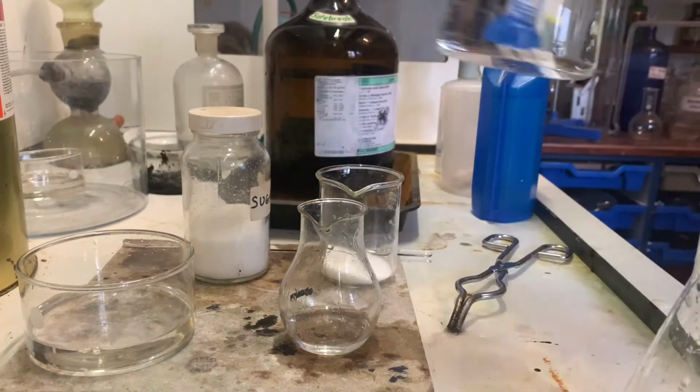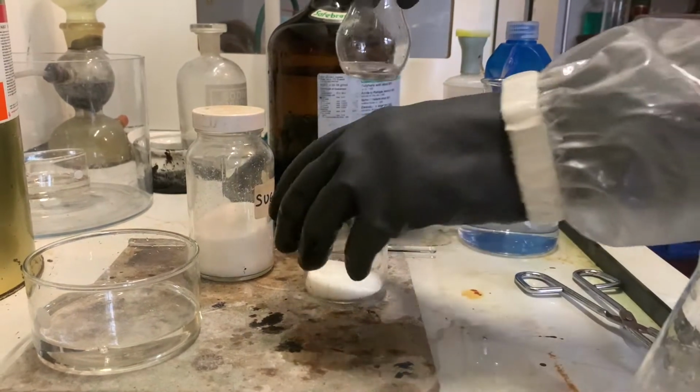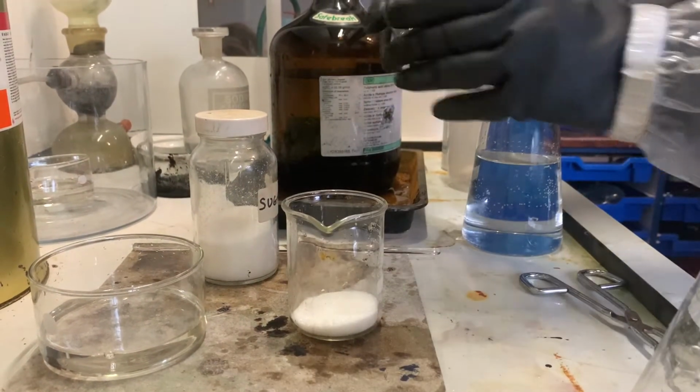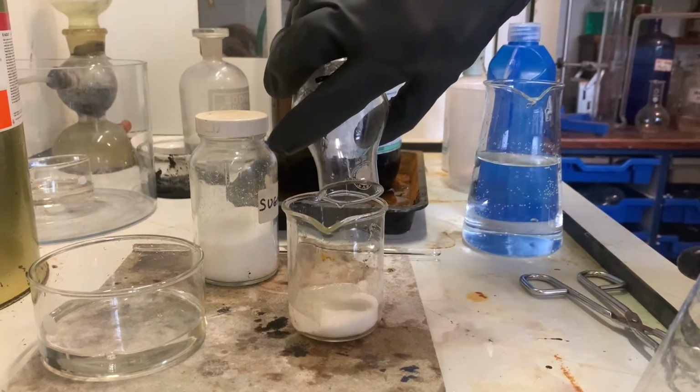So I'm going to show you also another very common experiment where sulfuric acid is added to some sugar. Right, so we're going to just add some sulfuric acid to just normal sugar.